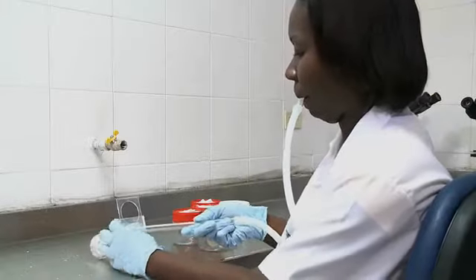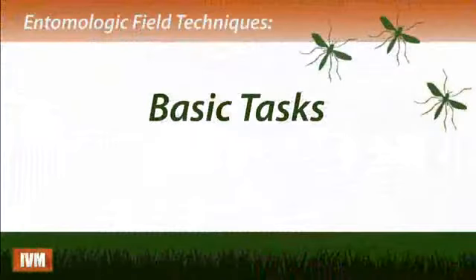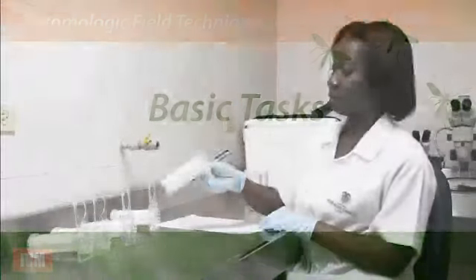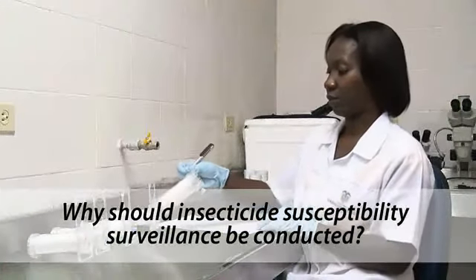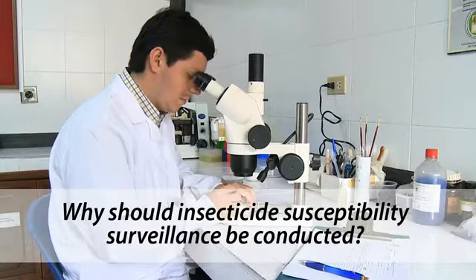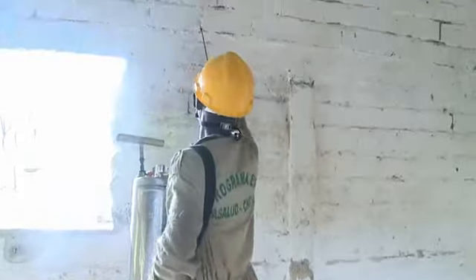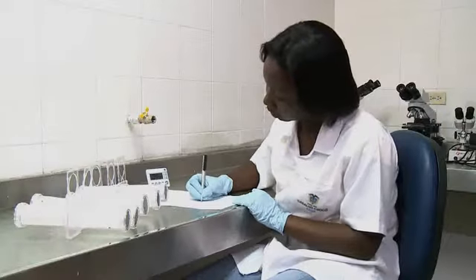This video shows methodology for testing insecticide susceptibility using insecticide-impregnated papers on malaria vectors. Surveillance of insecticide susceptibility is very important because, along with insecticide efficacy tests in the field, it allows regional and national disease control programs to make decisions about pesticide use.